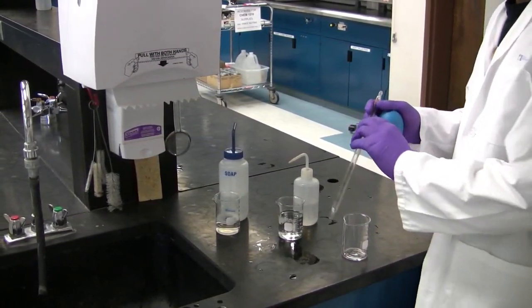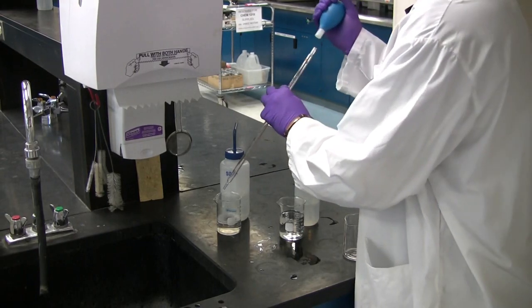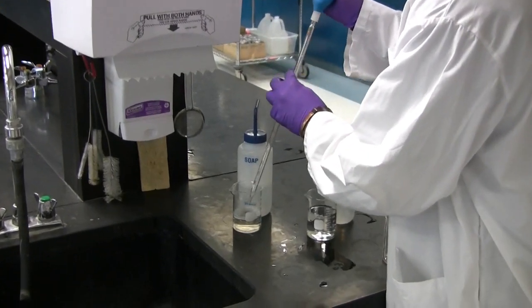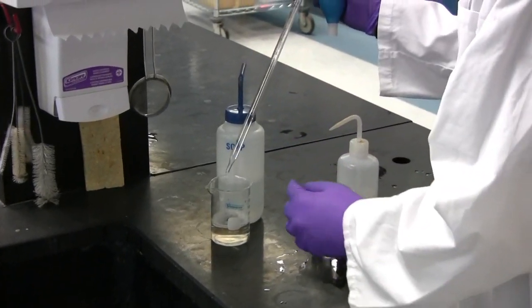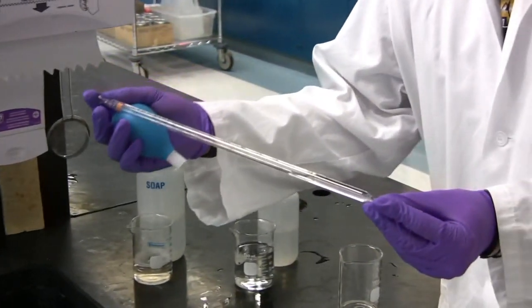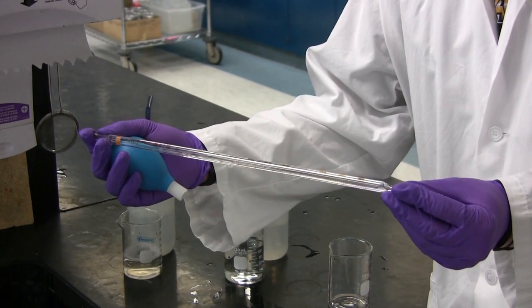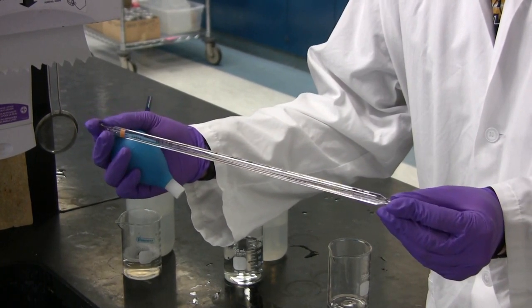With either pipette, start by placing it into some soapy water and withdrawing some liquid inside of it. Next, you need to tilt it back and forth and ensure an entire coating of the inside of the pipette without spilling any liquid.